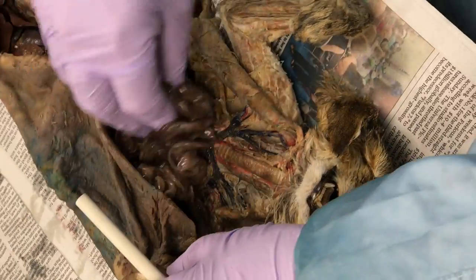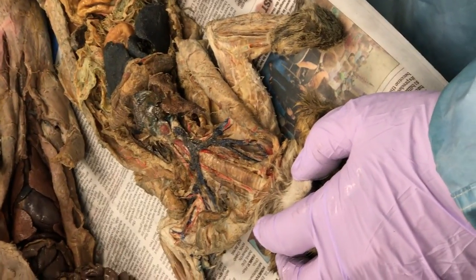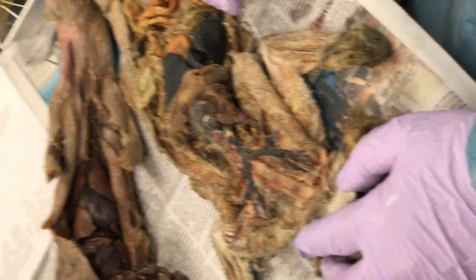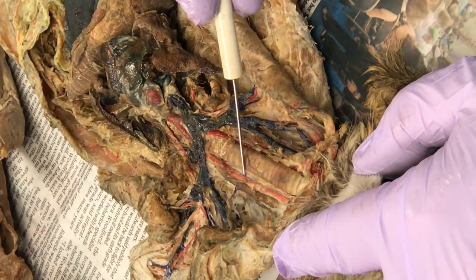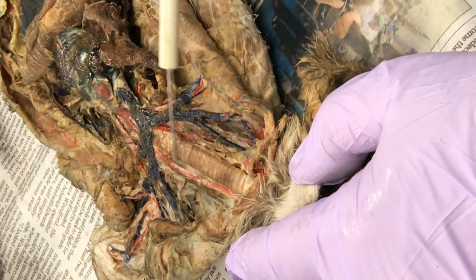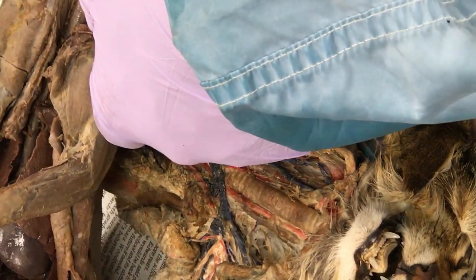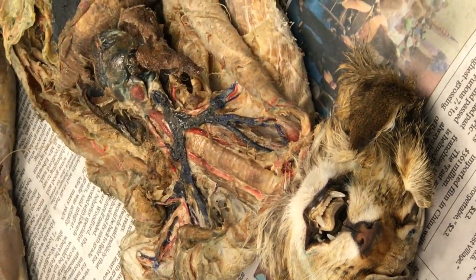Now that I've got the secret — just rub some mink grease on it and preserve it. Look at that, it's like a new life formula or something. I could market that — women would buy it because it would restore their face to their youthful appearance. It's a lie, but they'd buy it. Carotid — they're easy. Carotid, carotid. The carotid — that pink thing there. And the ones they tied off were the carotids — they've got the little threads on it. That's the carotid. Very tiny.